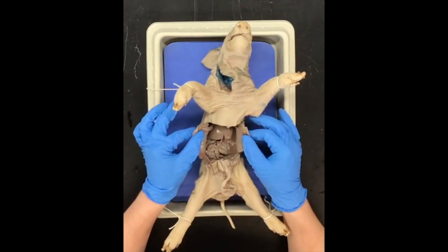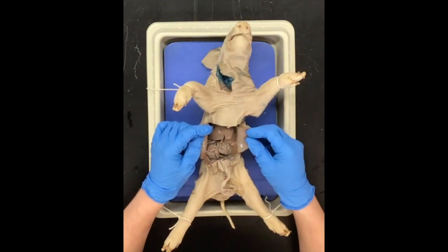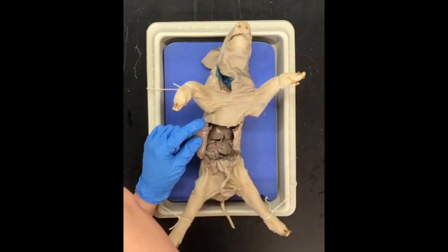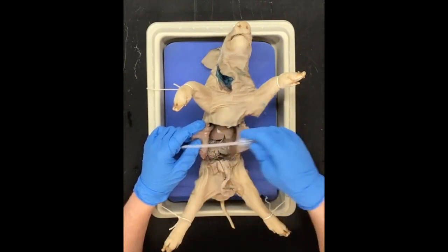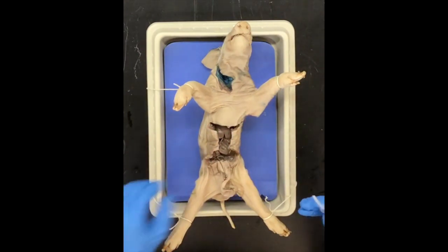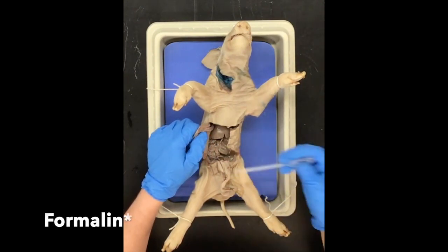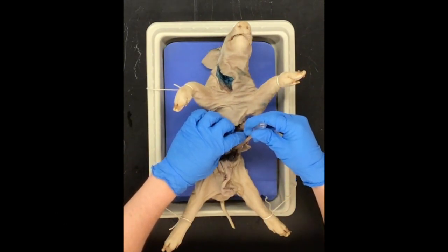All right. Now, as you can see, we've made two flaps. Notice there are some juices on the inside of the pig — we don't necessarily want those in there, so we are going to remove them. Those are natural juices created by the pig's body, as well as some of the juices that got into the pig from it being in the preservative fluid, which is a type of formaldehyde — but not formaldehyde. So we are going to remove some of these juices.